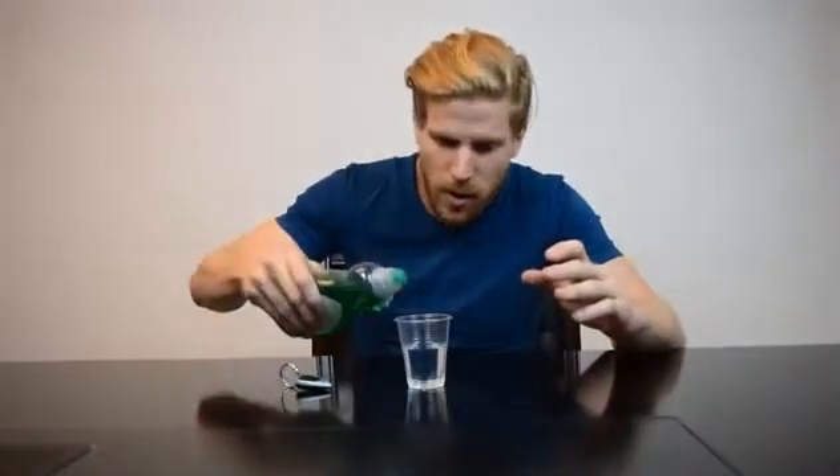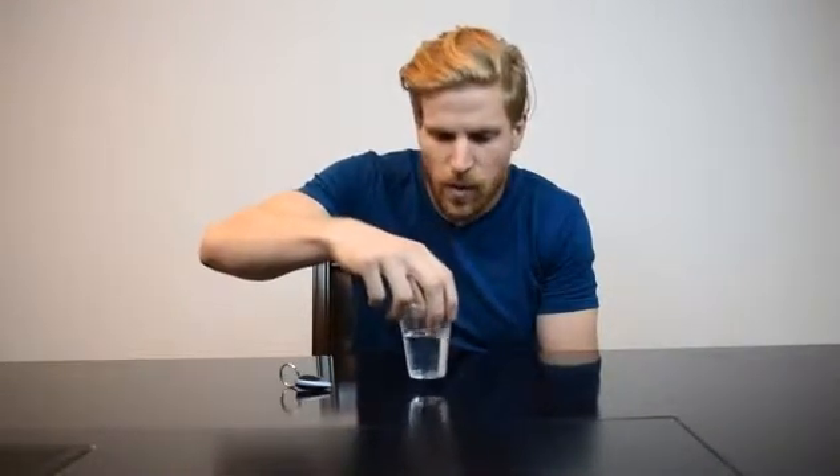Now I'm going to show you what it's like when you do detect a contaminant. We're going to take some of this dish soap — everybody has it in their home and there are tons of chemicals in it. Pour just a drop in. Now I'm going to swirl the cup for about five seconds, set it down on a hard flat surface, hold the device a few inches away, press and hold the middle button, then release. We got a red light, which indicates that we've detected contaminants in this water, and you obviously would not want to drink it.